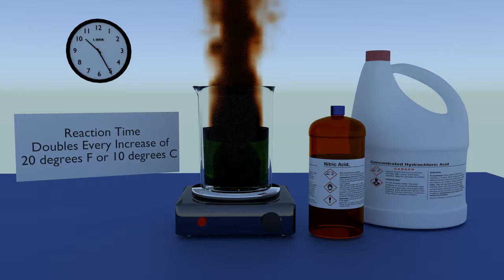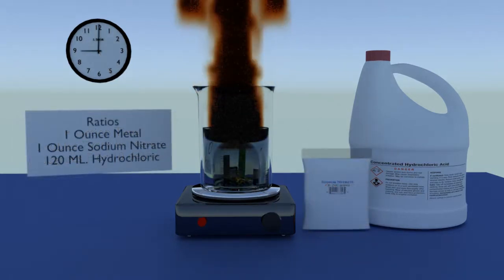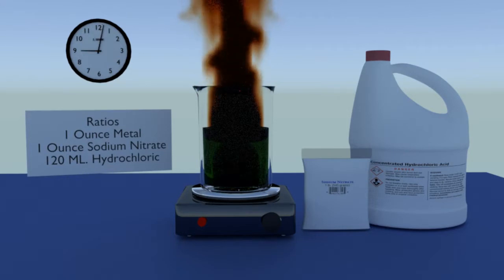Sodium nitrate dissolves very slowly at room temperature, requiring an extra few hours. Because of extended dissolving time, you may want to heat your acid to speed the dissolving process. However, please note that heating will significantly increase fume production, and of course hot acid is potentially much more hazardous than room temperature acid.